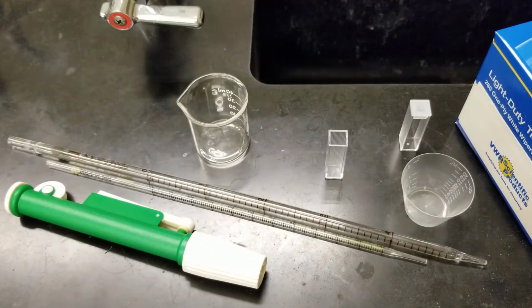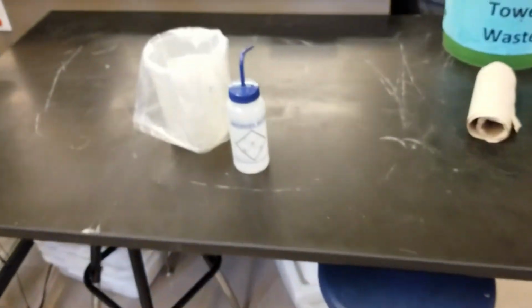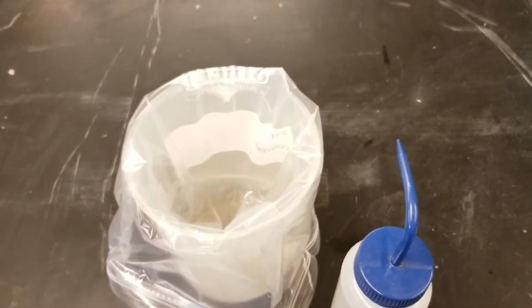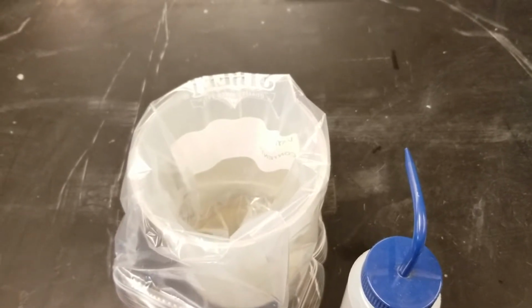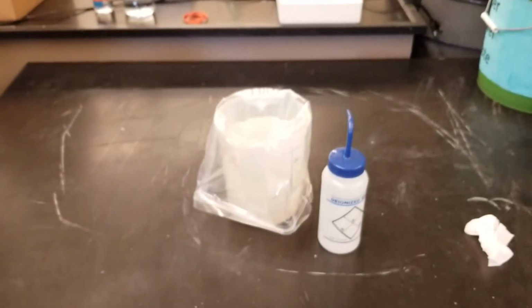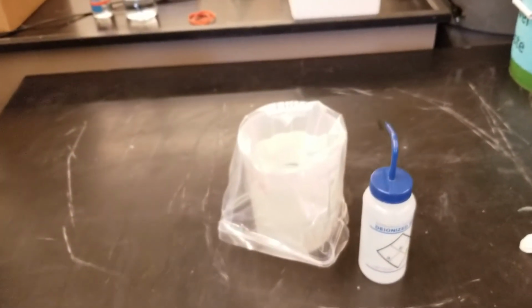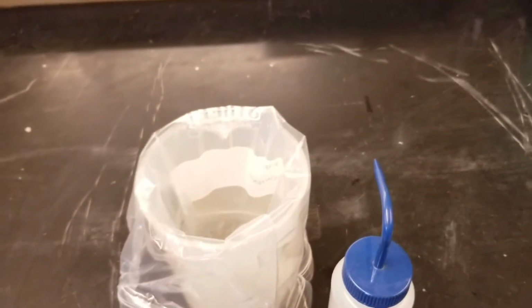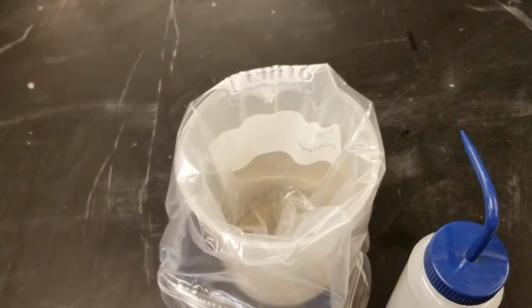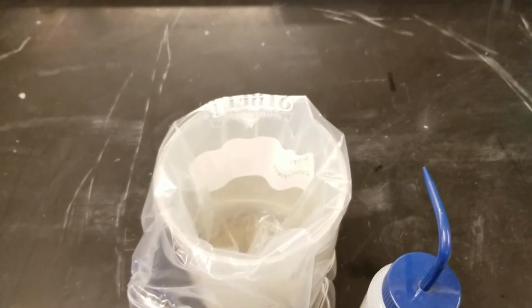And the last thing you need to pay attention to is that the thiocyanate and the iron, they shouldn't go down the drain because of their low pH. And so I've got to treat these before we deal with the waste. And so over on this bench, I've got a waste bucket. Make sure that if you're rinsing any of your solutions, rinse them out into here so that I can treat that and follow King County hazardous waste protocols.